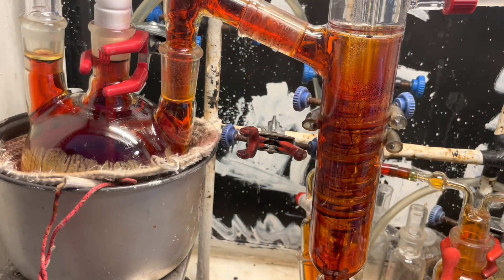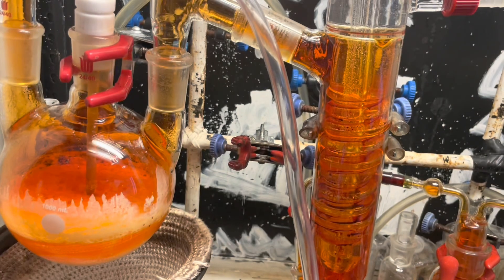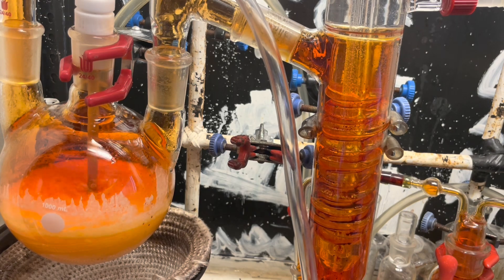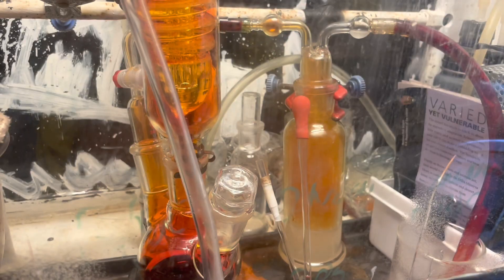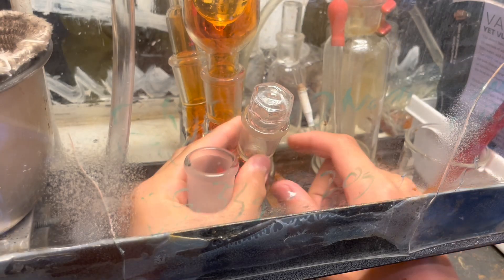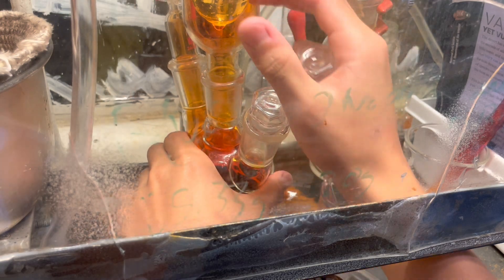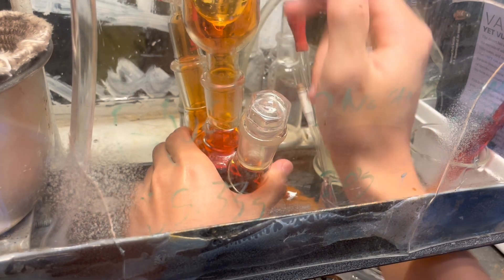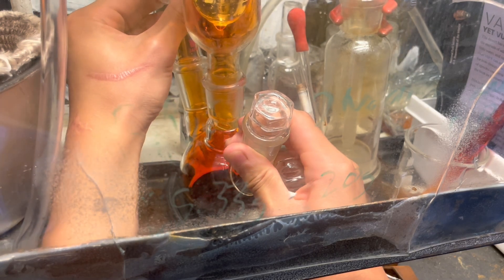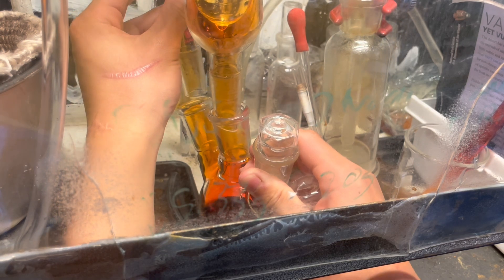It's almost summer and it's a very hot day with both doors open for ventilation. The bromine's done distilling, so I've swapped in a gas adapter on the left side flask and I'm just going to blow air through the setup to purge out the bromine vapor. We had a little suck-back, but that's fine - that's why we had the trap there. Now I'm going to remove the receiving flask, which is connected to the scrubber, and swap it for a normal flask so the apparatus is airtight.